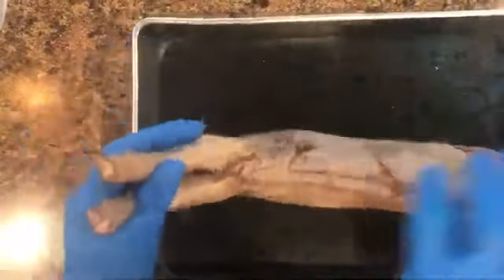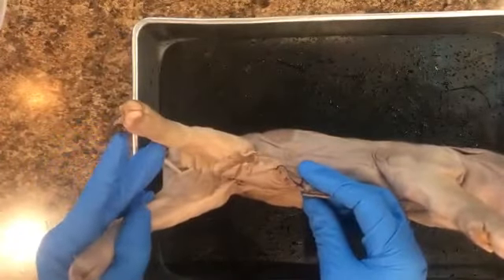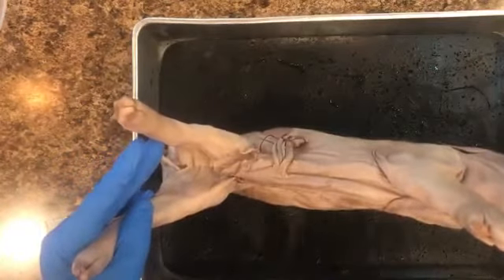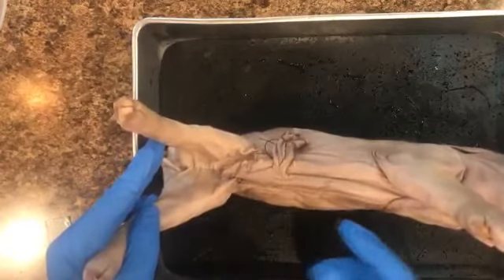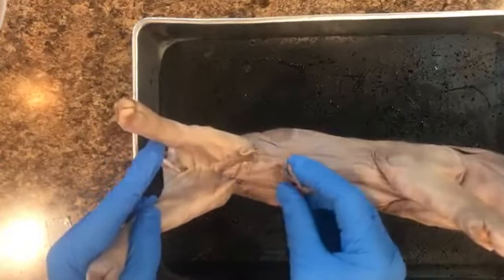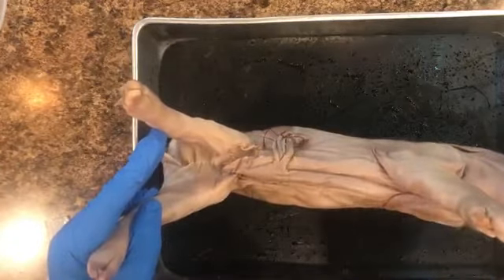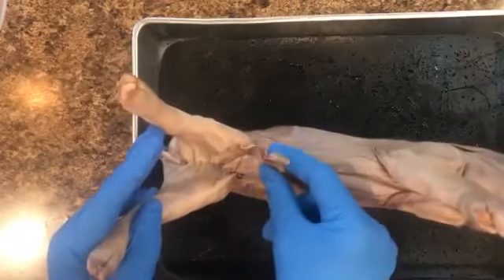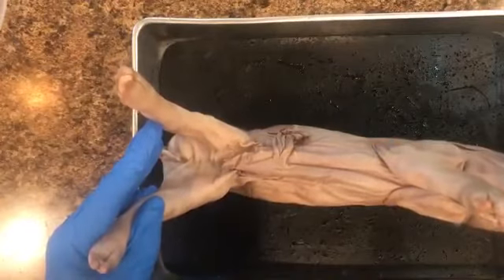So this here, ladies and gentlemen, is the umbilical cord. Just for anyone who might be wondering, is that the penis? No, it is not the penis. It is the umbilical cord. All the fetal pigs have an umbilical cord. The umbilical cord's purpose is how the baby is going to get nutrients: food, water, oxygen, blood. This is the exchange right here between the fetus and the mom.